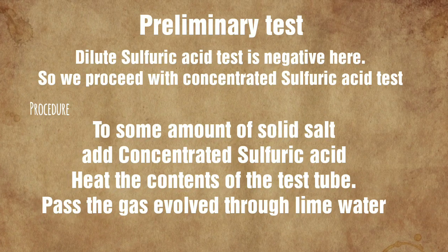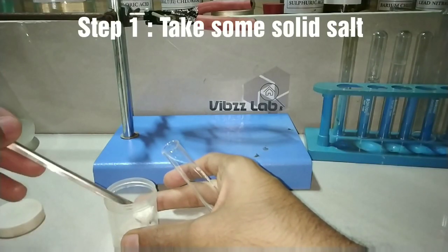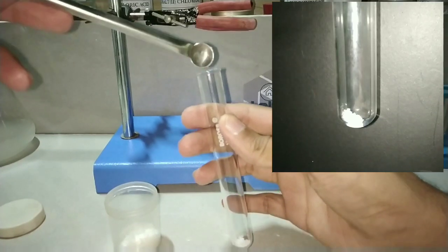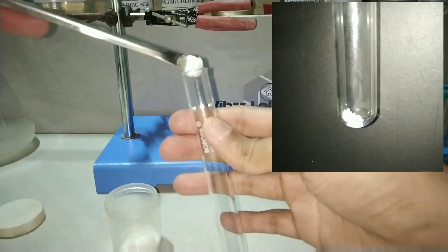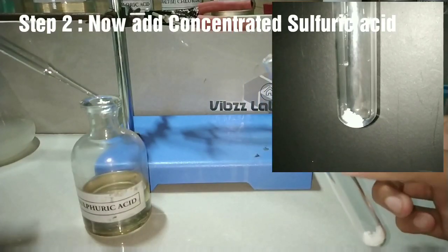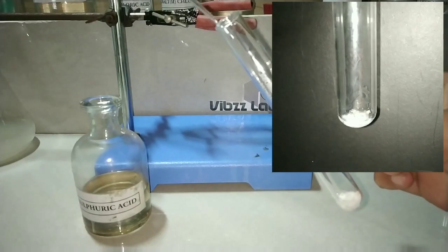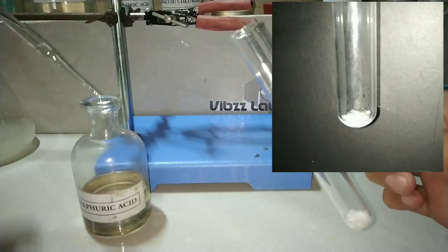Step one is to take the solid salt in a clean and dry test tube. The next step is to add concentrated sulfuric acid into the test tube. Always use a dropper while adding the acid, as it is corrosive.